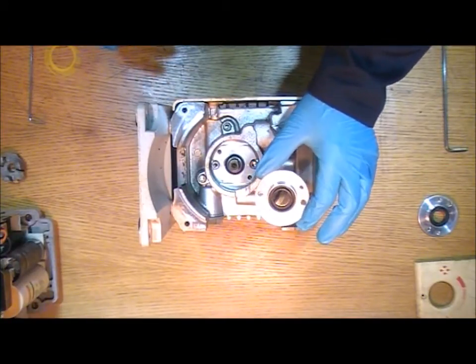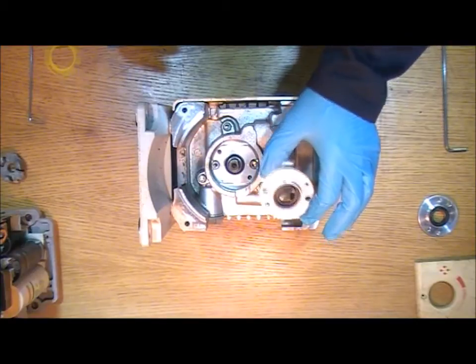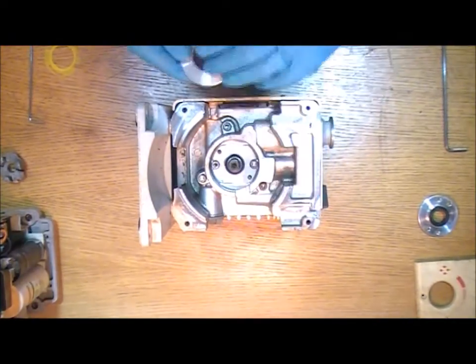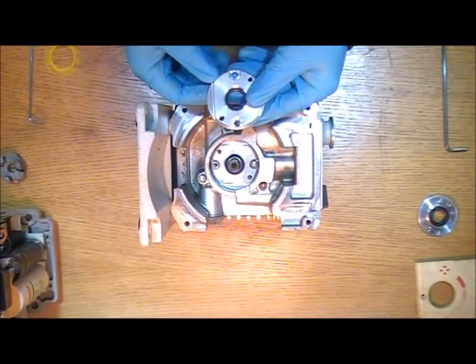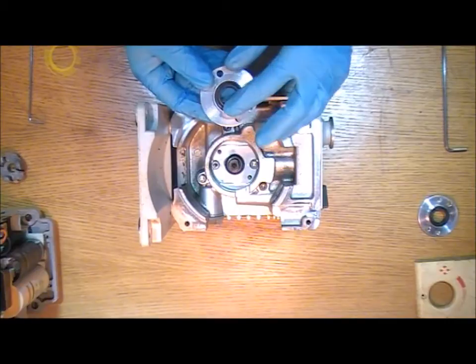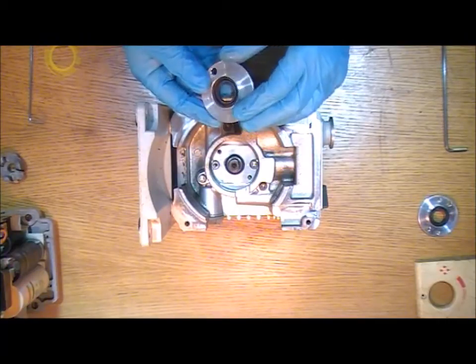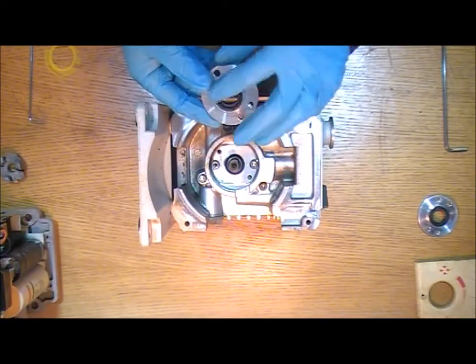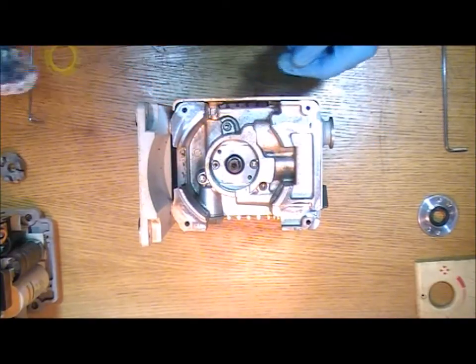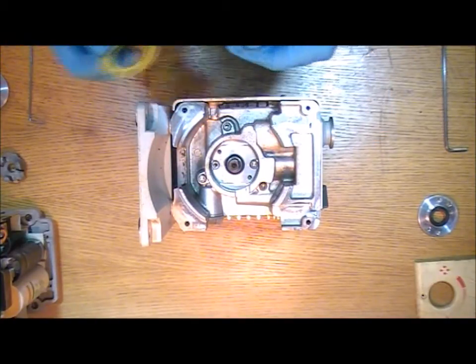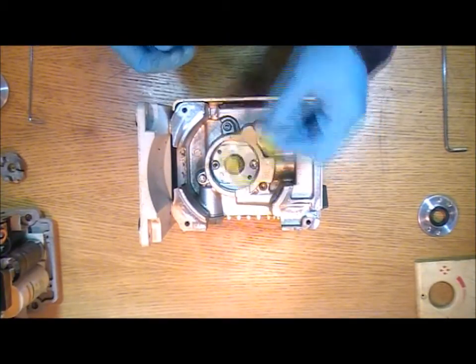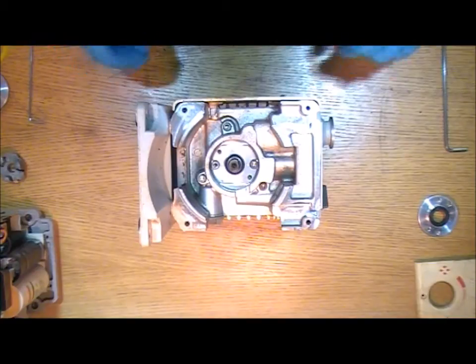Now I would recommend going for the pre-assembled kit. The reason being that if you take the seal out of the pump it can be difficult to remove from the carrier. And you also really need a bearing press or a bearing driver kit in order to seat the seal properly into the carrier. So the pre-assembled one is a good move. You'll also have a yellow gasket like this and we'll see where that goes in just a moment.